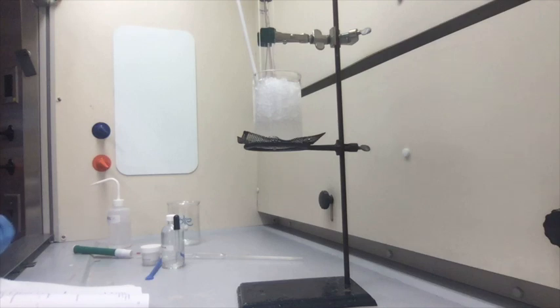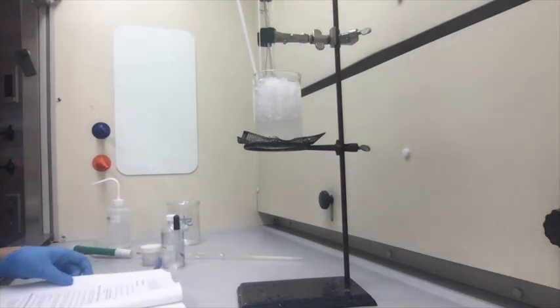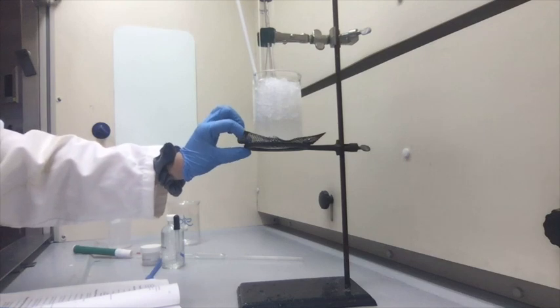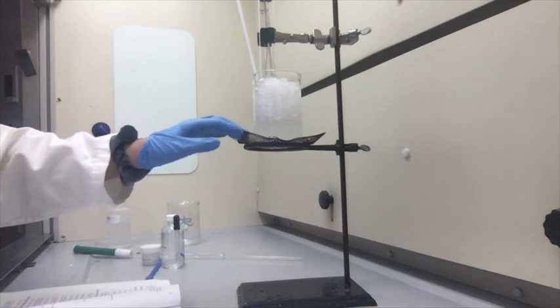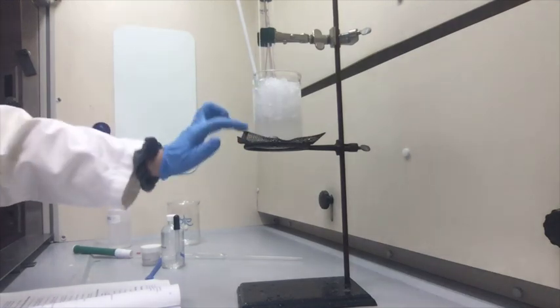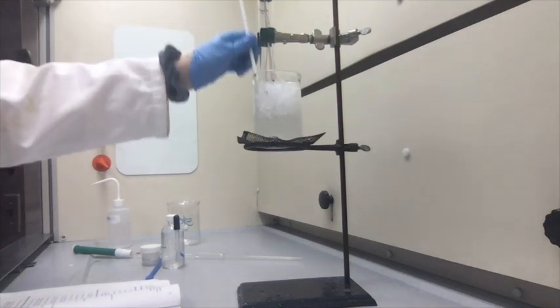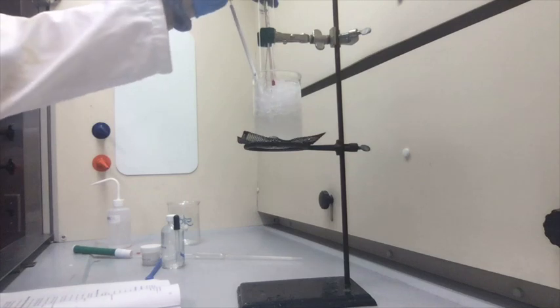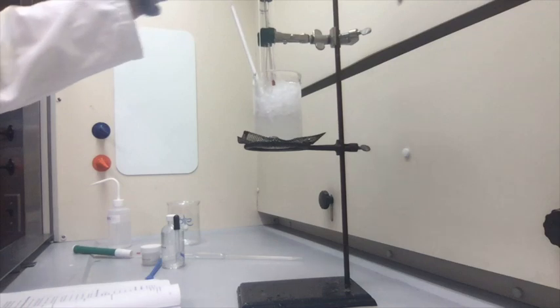We're going to start with experiment 2, a molar mass from freezing point depression. Step 1, using a pipette aid, pipette exactly 20 mL of cyclohexane into the apparatus. I've already set up the apparatus here, so we've got the ring stand, the iron gauze, and then we've got our beaker with water and ice. We've got a little stir rod so that we can make sure that the consistency stays as such. And we've got our test tube, thermometer, and another stirring stick in our test tube.